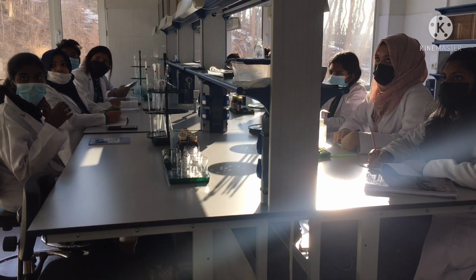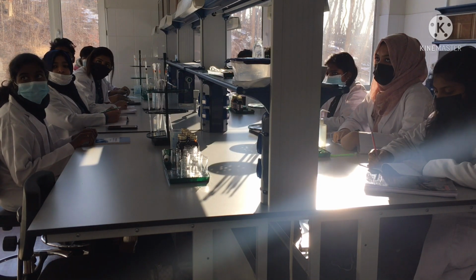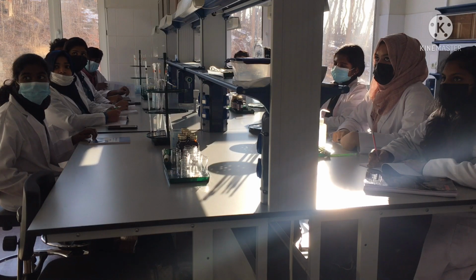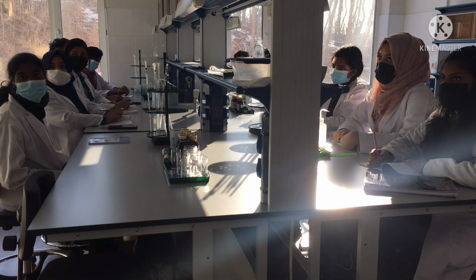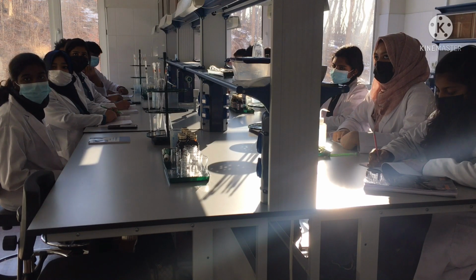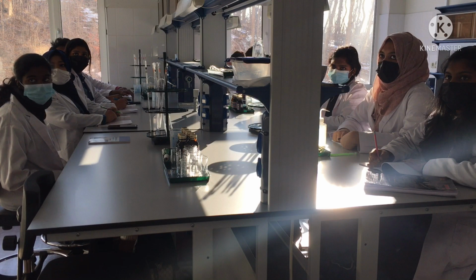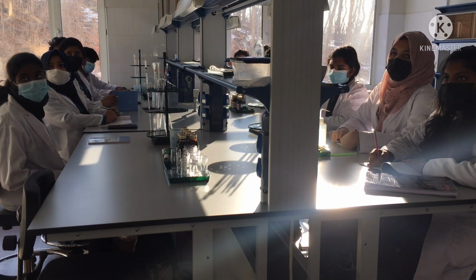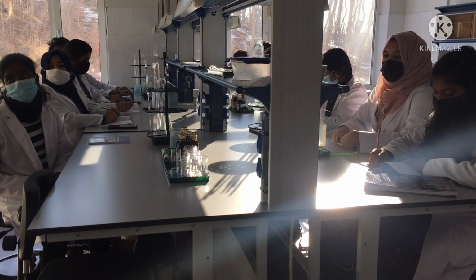Today we will have a lab work, kinetics of the iodine clock reaction. This is the laboratory work that can help us to study chemical reaction rate. We will have today a reaction of these components, as you can see in your manuals and on the blackboard.